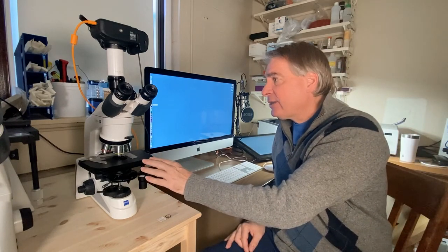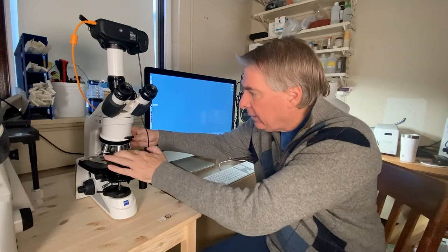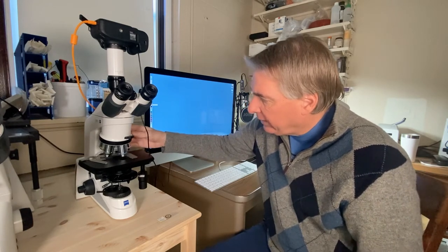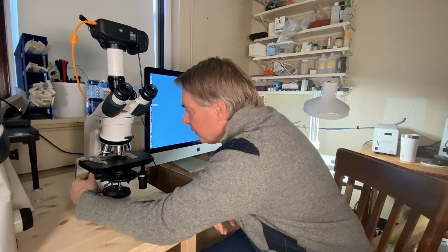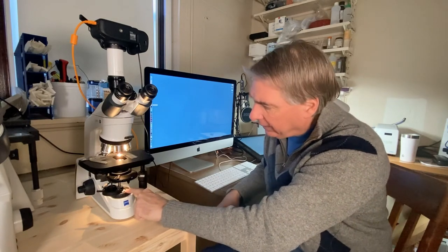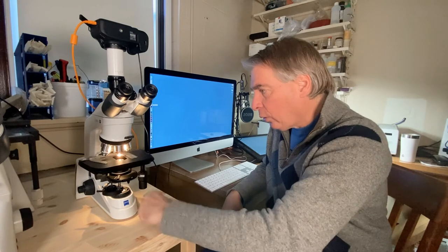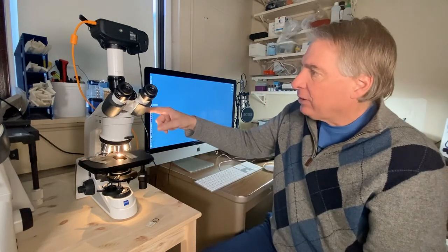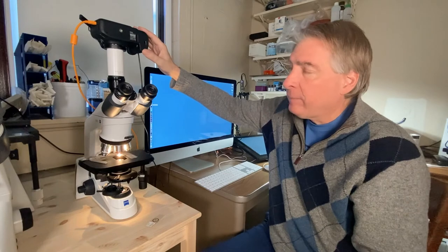The microscope that we're using is a Zeiss Lab A1. It's a very nice compound microscope. The red objective is 5x, yellow is 10x, green is 20x, blue is 40x, and white is 100x. To turn the microscope on, the light bulb is in the base; there's a button on the left-hand side. Light emanates from the bulb and goes through the condenser lens, which focuses the light onto the specimen. We have the stage which holds the specimen, and the microscope objective magnifies the image. The light can travel either to the eyepiece or to the camera to take a photograph.